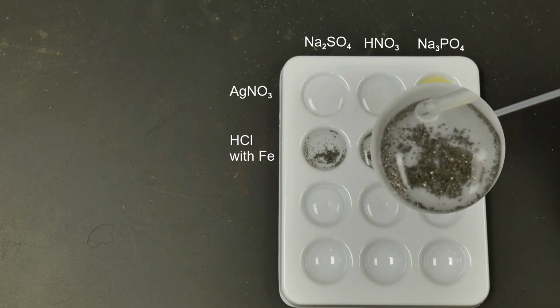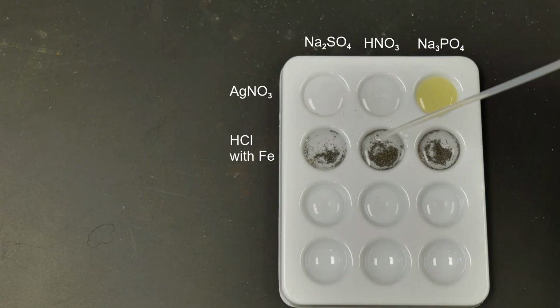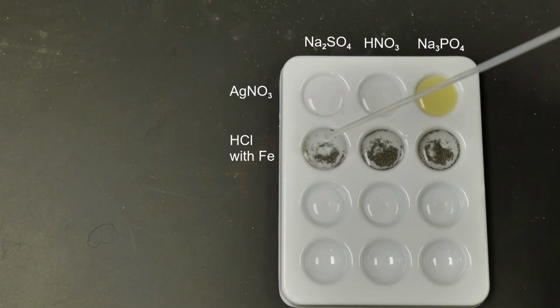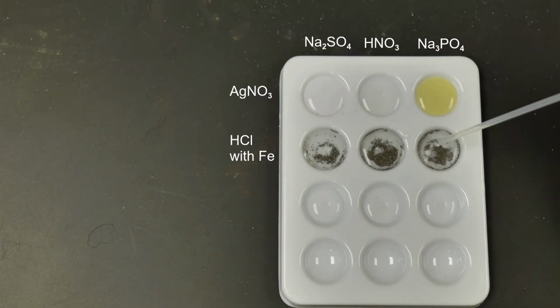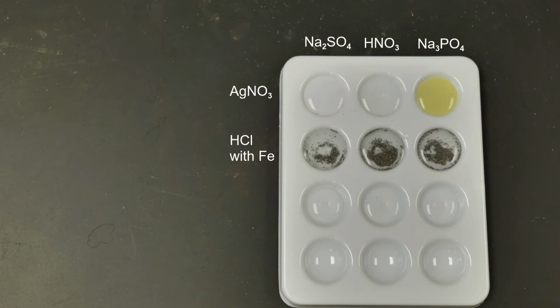Again, do we notice any changes occurring in any of these 3 wells? Make sure we add enough hydrochloric acid in each one, just to make sure we have enough. All right, so make down any observations, and we'll move on to the next part.